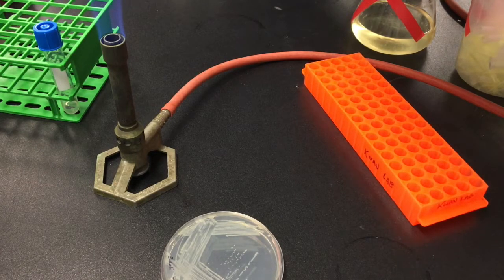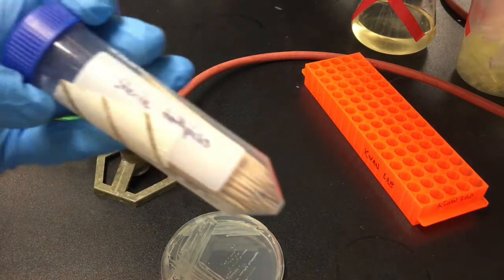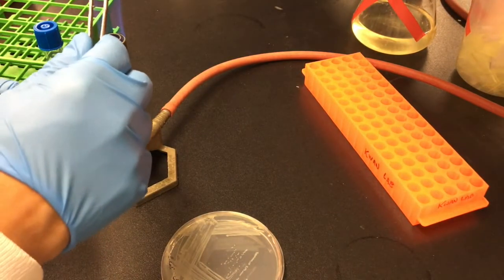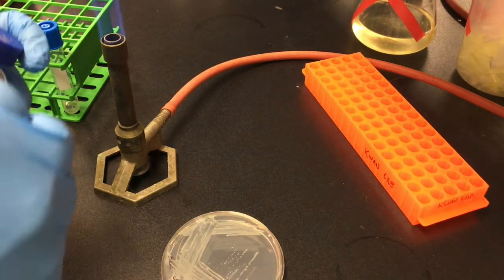In this video, I will show you the growth of E. coli in different conditions, that is, with and without tetracycline, and the extraction of RNA from cell samples, which you will do yourselves in your upcoming lab.